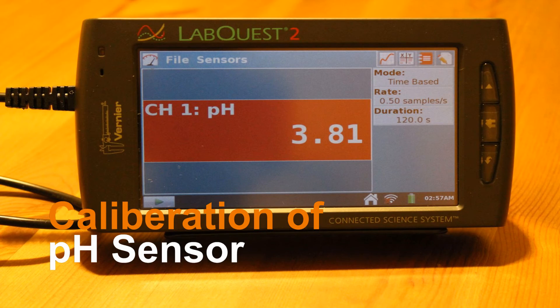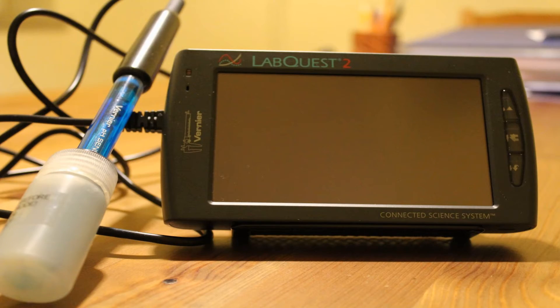This video shows you how to calibrate a pH sensor using LabQuest 2.